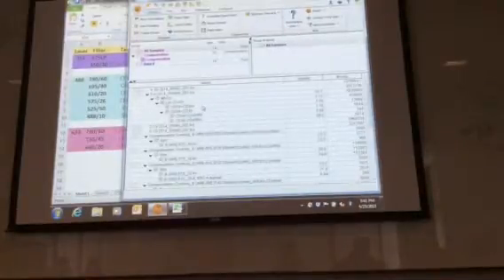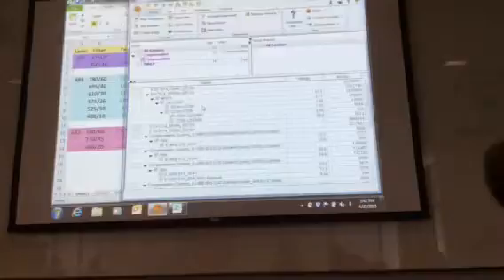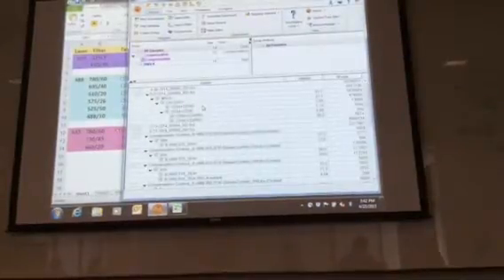The count, what do you mean by the count? I see that in the y-axis in the assignment there's a count there, but I'm not sure what that is. How to choose the count parameter. Oh, the count just means it's a histogram. So whenever you're looking at just a single parameter, you don't have to look at it against a different parameter. The count just means you're going to show it as a histogram and then determine the positive and negative off of the histogram.